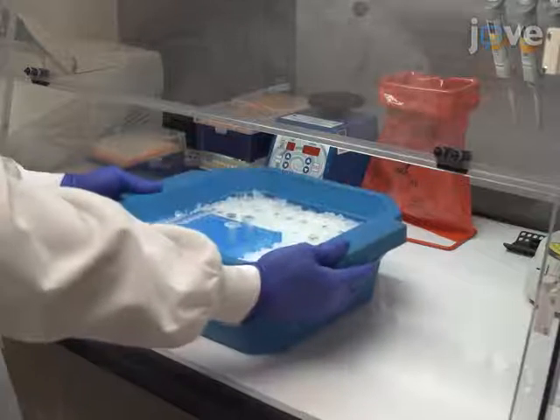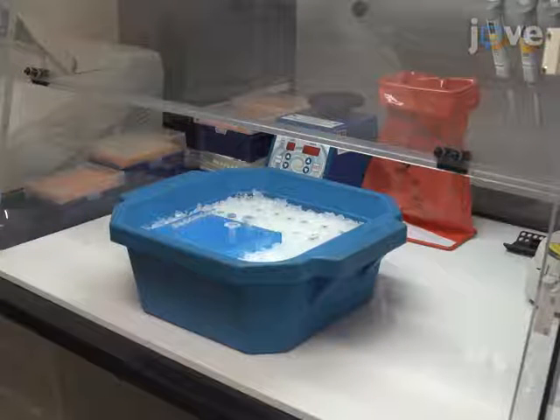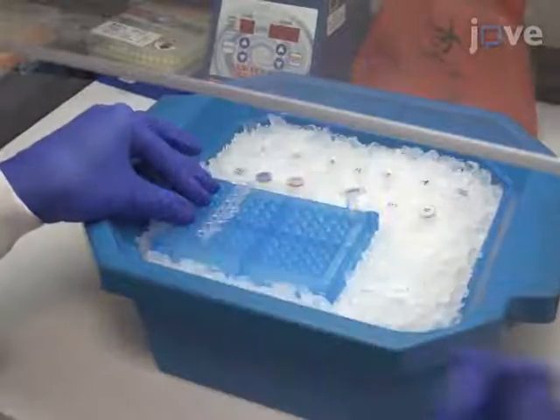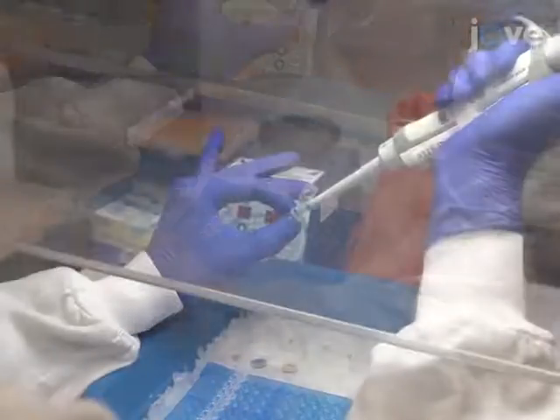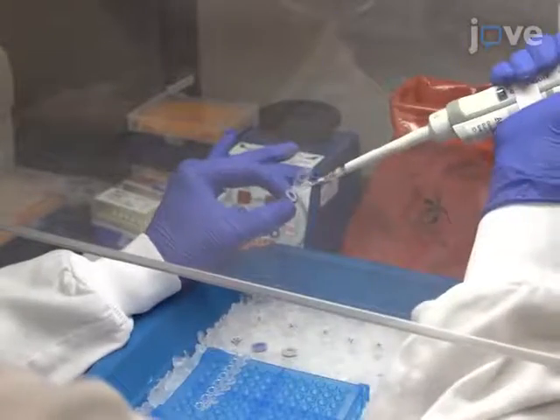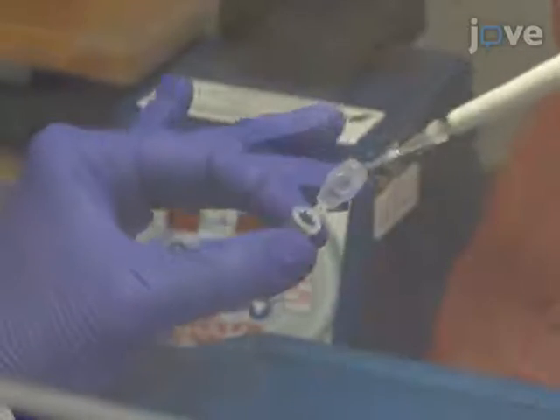Circulating RNA for the reverse transcription reaction is isolated from blood samples from donors as described in the text protocol. Convert the concentrated circulating RNA sample to cDNA using a commercially available reverse transcription reaction kit, including random primers. Include a no reverse transcriptase control sample and a no RNA control sample.